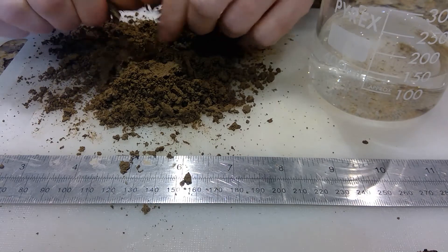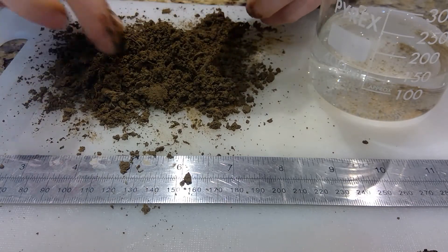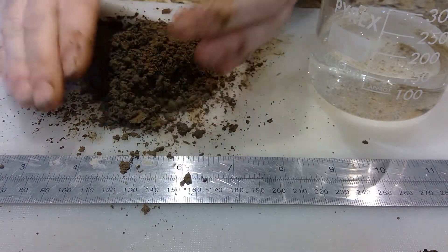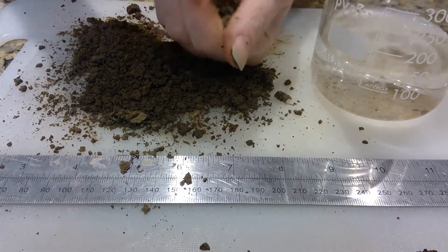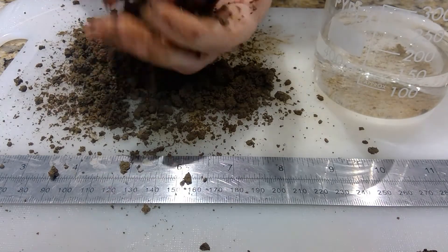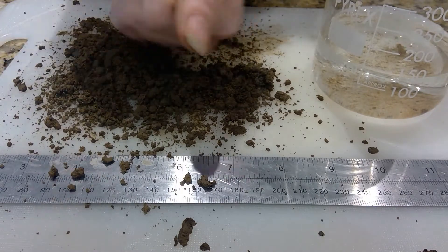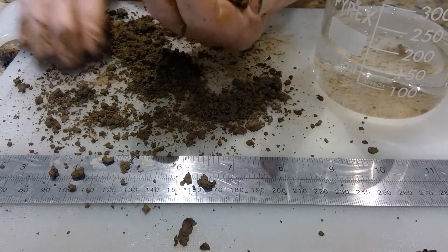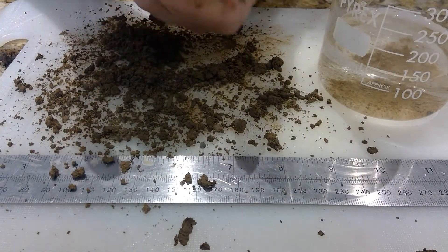What I'm going to do is gather my sample and put a small bit of water in it. The sample isn't completely dry so I don't need much — about two mils. I'm going to work it in my hand and form a ball; this should take about two minutes. As I'm doing this I'm feeling for grittiness and smoothness. Clay has an elastic property which allows it to be molded.